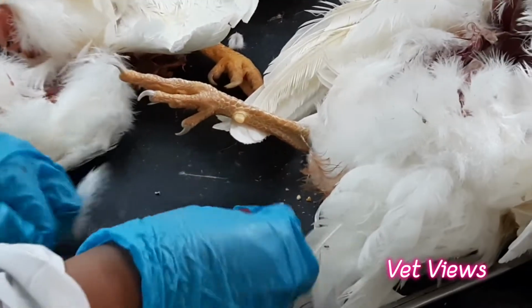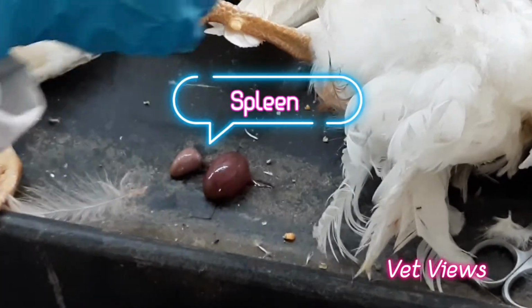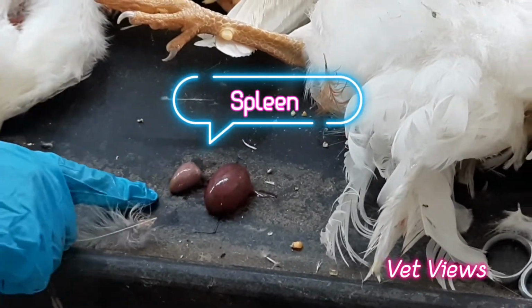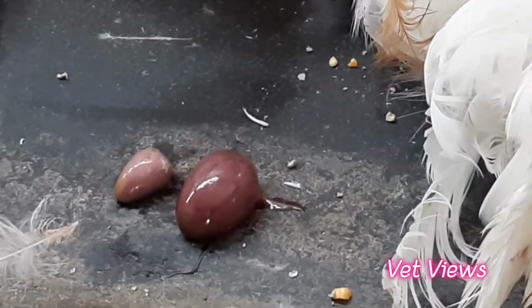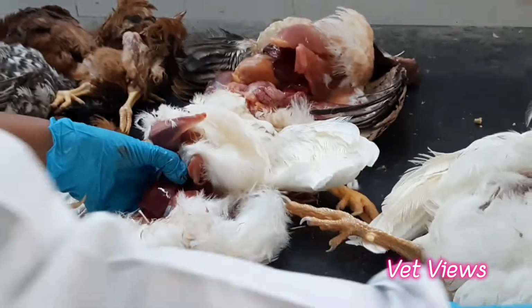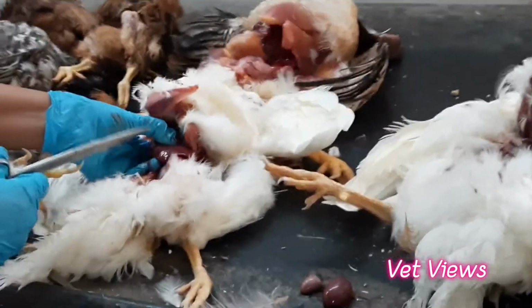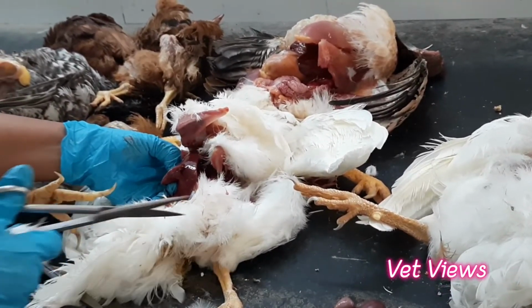Here you see this is too big. Both are of the same flock, same age. This is a normal size and this is too enlarged. So here you can suspect something, but the liver is not so big, just a little enlargement is there. See, little enlargement is there. It may have some tumor transformation. It's not very severe, but initial stages. In the spleen, it is clear.